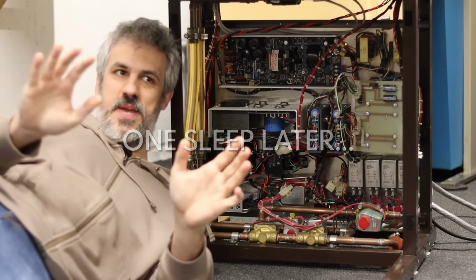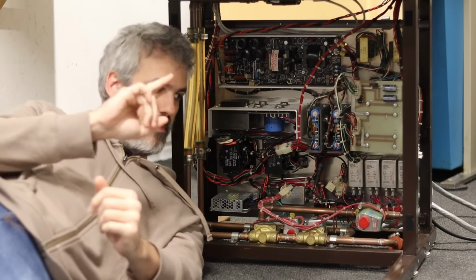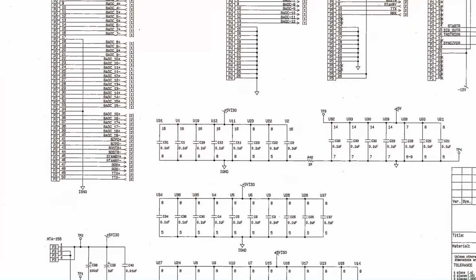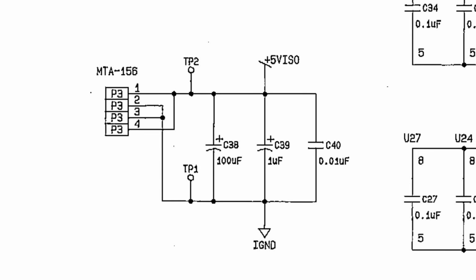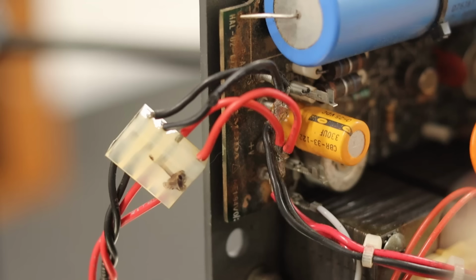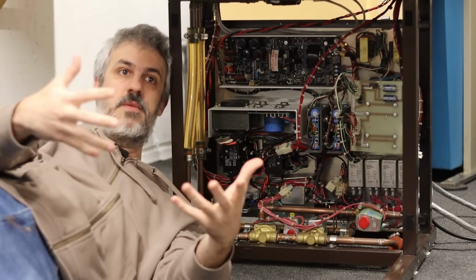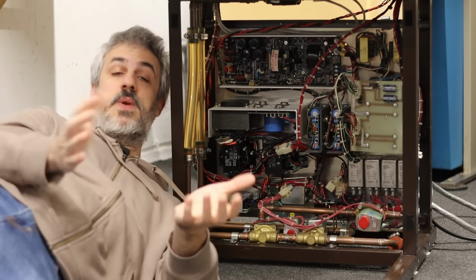Whenever I have a problem that just doesn't make any sense, it's always grounding. And usually it's because I don't have enough grounding because I'm lazy. But in this instance, it's not that we don't have enough, it's that we have the wrong grounding. If we look at the schematic, the 5 volt that we're supplying to the opto-isolator board is actually an isolated supply. It's marked as plus 5V ISO and GND ISO. And right now I've just got it tapped off of this little Mean Well down here because that's where they did it originally. I can't tap off of that, and I have no idea why they were able to tap off of the equivalent linear supply on the original version of this, but we can't do that here.